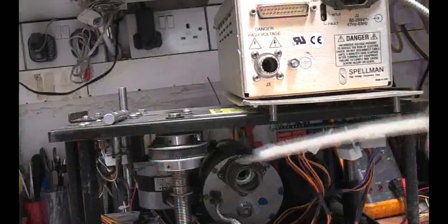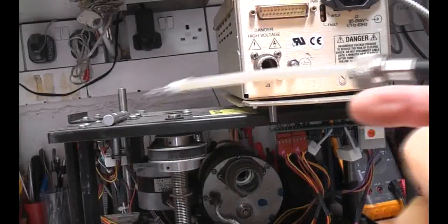There's a little red laser module, presumably for alignment. Looking at what's on the main board, I'm pretty certain this is almost all just power supply and a few bits of interconnect - nothing obvious in terms of functionality going on here. This is all going to be done on the PC card.